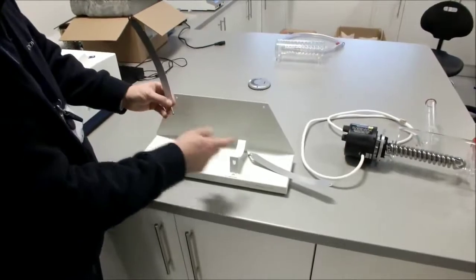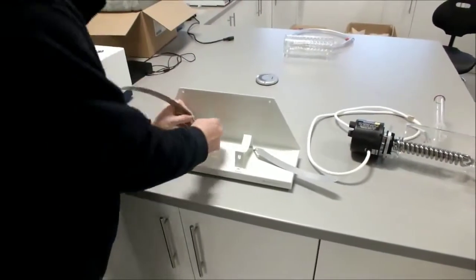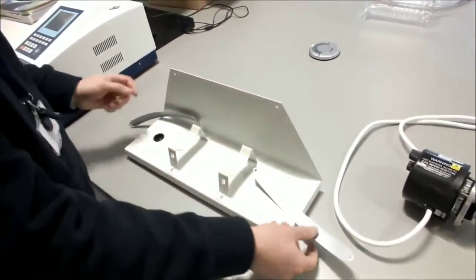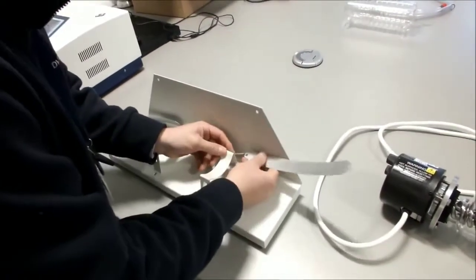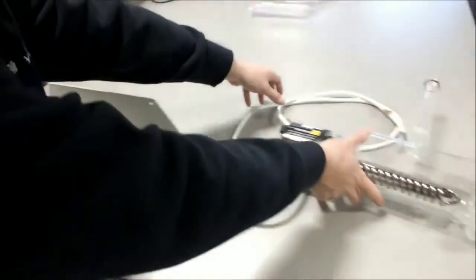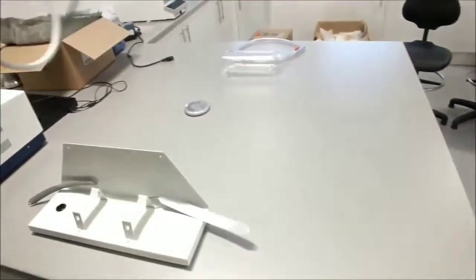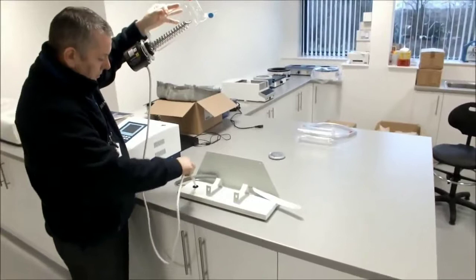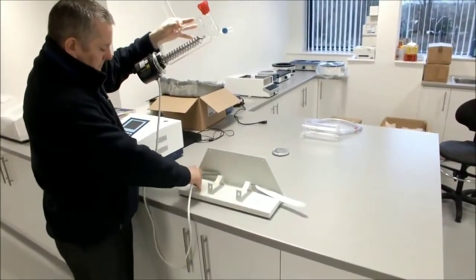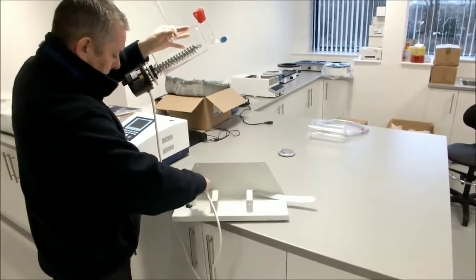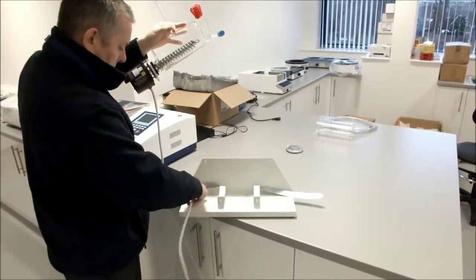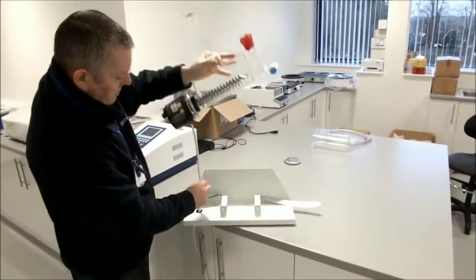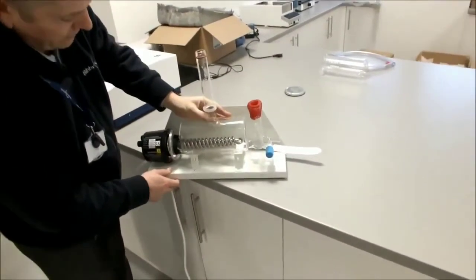What we do then is we get our two straps. Each has got a spring on the end and we place the springs on the rear of the cradles. So we then take our heater and boiler assembly with our cable hanging down and we thread the cable through the hole in the base.